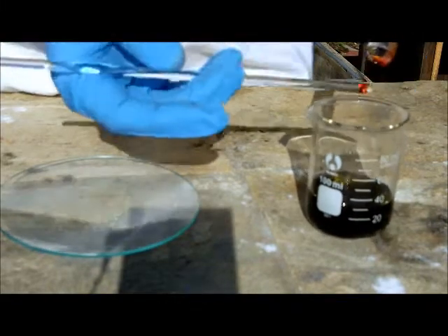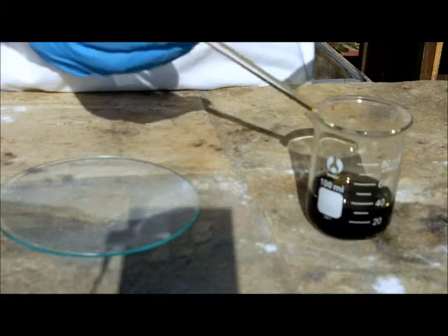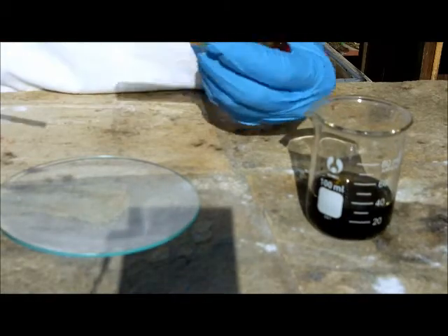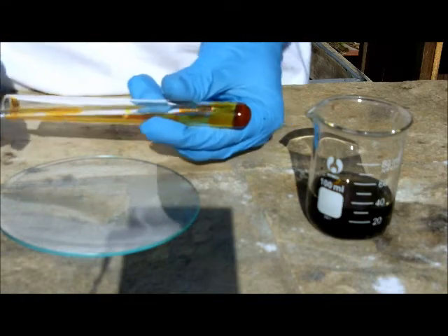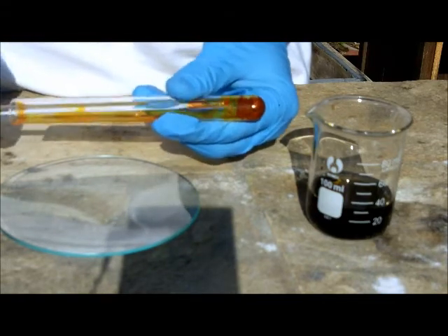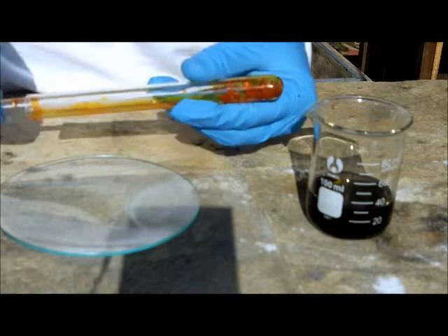Okay. Now, get the rest of these crystals out. This can be pretty hard if you have a test tube, but do your best to break them out and put them on your watch glass.